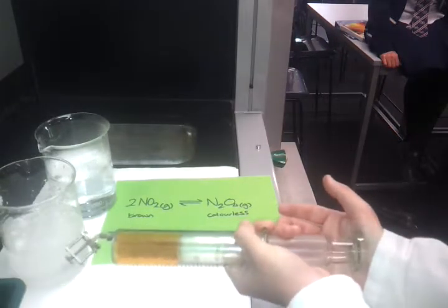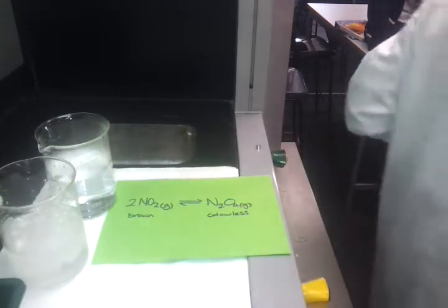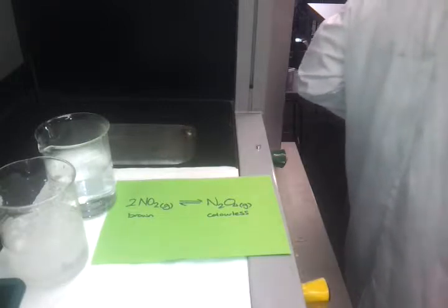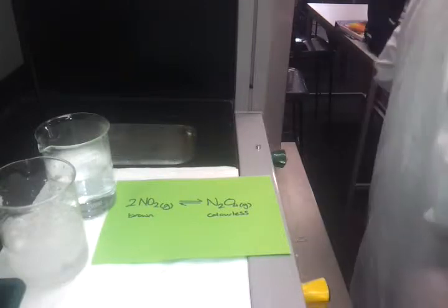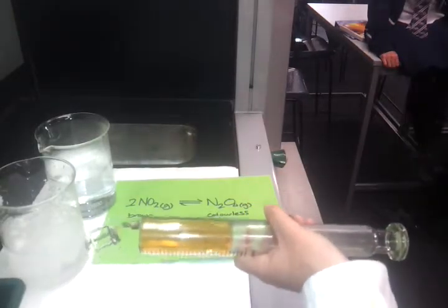So I hold it in and it goes darker first of all, and now it's starting to fade again. I'll bring it out and show you that again. Like in front of me, you can see it. It will go darker first, but now you can see it starting to fade. Only subtle, okay, but it does fade. It's probably easier to show you the other way, where it will go lighter and then start to darken.